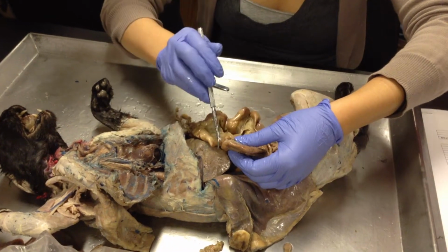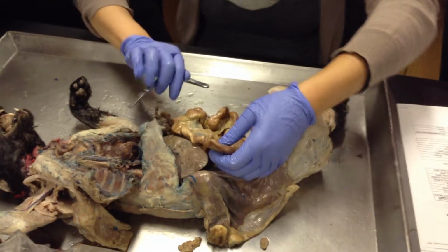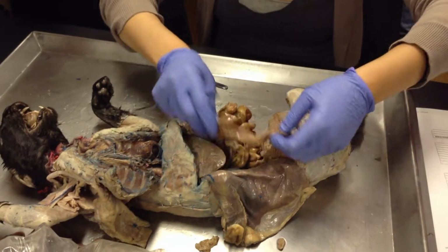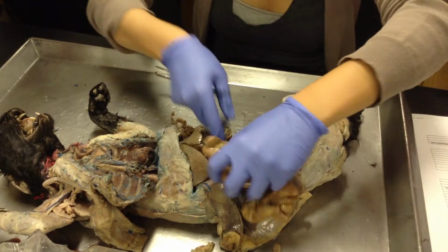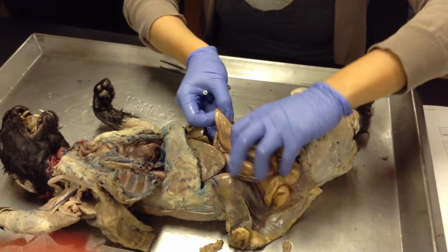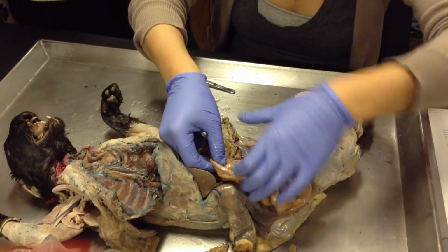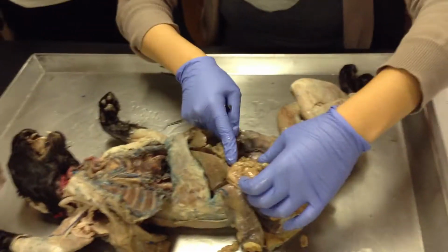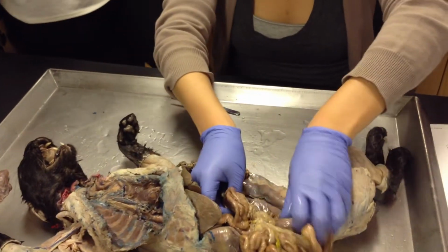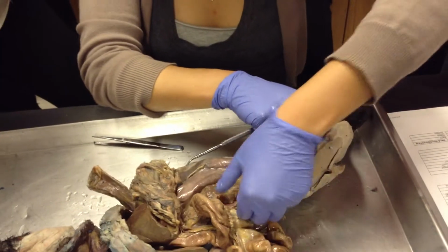Right. Do you guys remember what this bulge was from the cadaver room? That's a cecum. Good. All right. So this right here, oh wow, I twisted it or something. But remember, it does a little rainbow thing, right? Ooh. So we have the ascending colon, ascending, transverse, and then this guy coming down right here is the descending. Can we see the sigmoid? No. It's generally pretty deep.